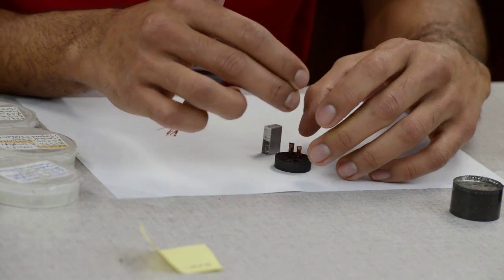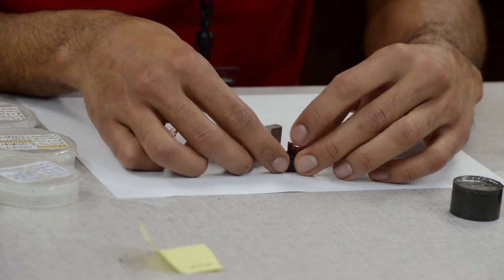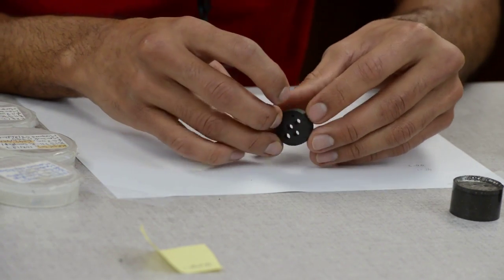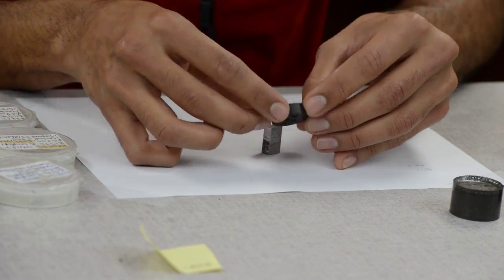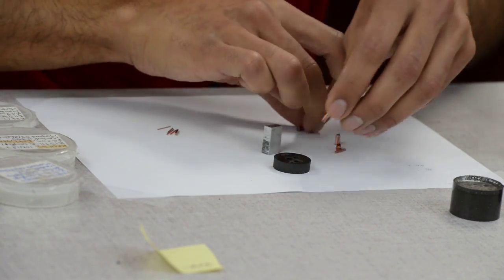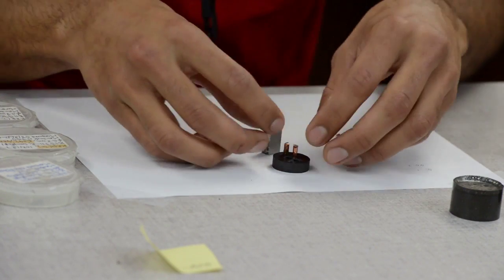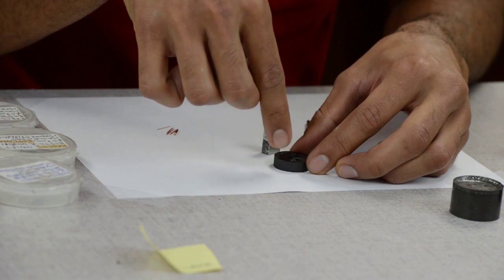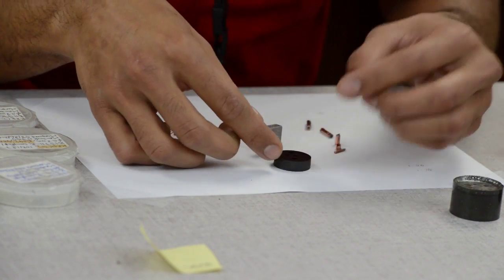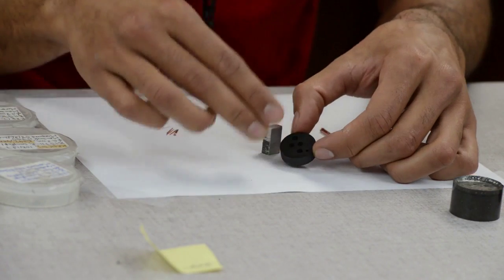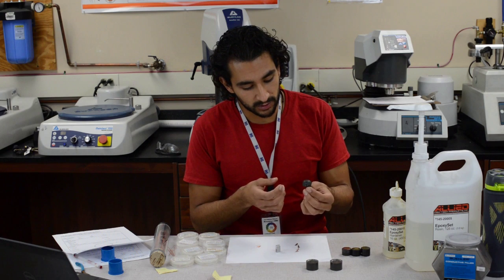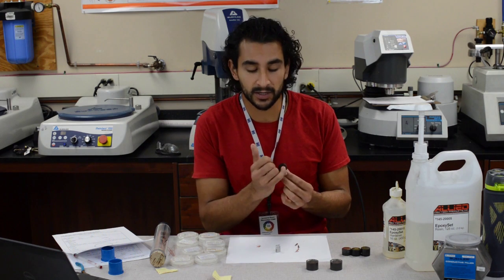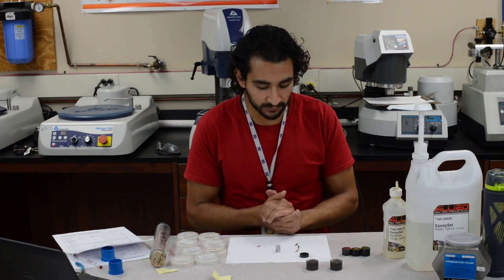Here's where it matters how you stack your samples. You can't make a square, because if you have your samples set up in a way that when you polish this face, you're going to be looking at them this way. When I'm putting them on here, they're actually inverted. For example, if I look at them from the top right now, the copper marker is on the right. But if I flip this, which will be the face that I'll be looking at once I polish this down, the copper marker will be on the left. So keep that in mind when you are making your diagrams. You can't make a symmetric structure because you will lose track of your samples.